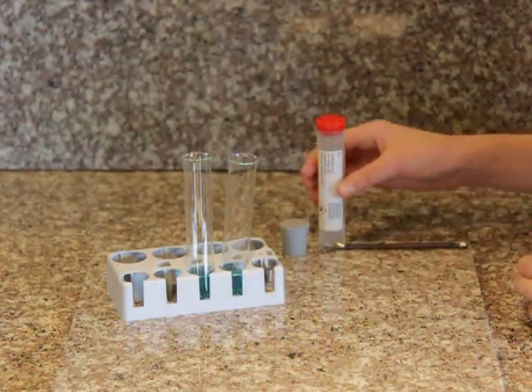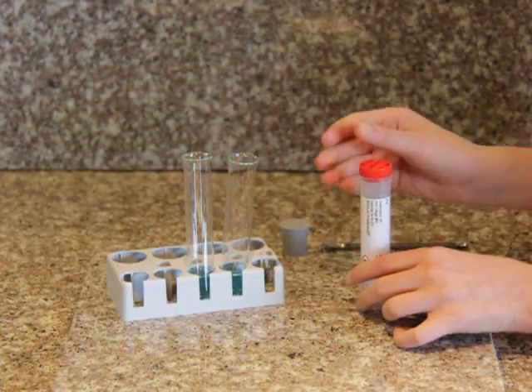Next, I need to measure one spoonful of iron filings into one of the test tubes.